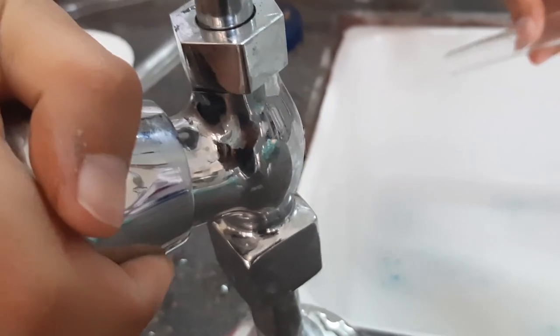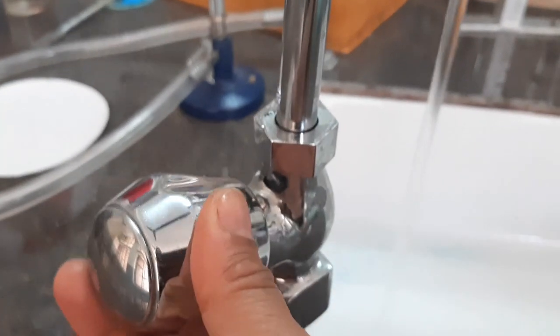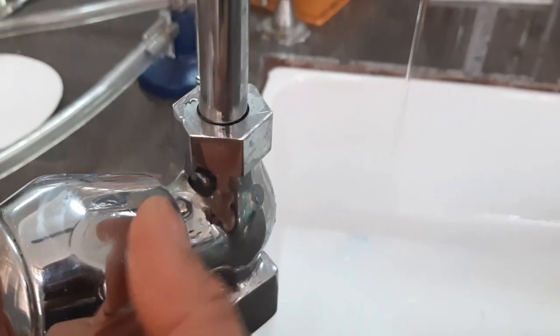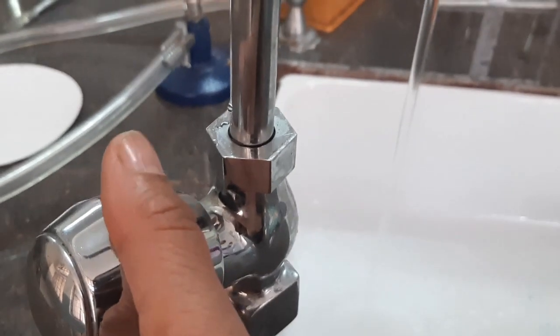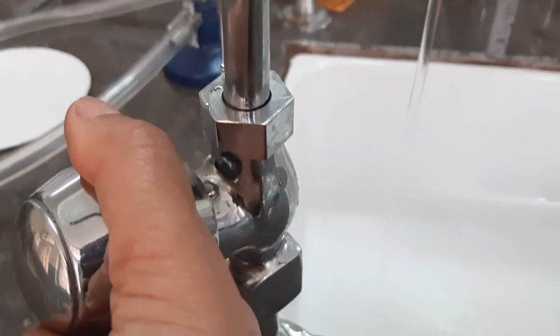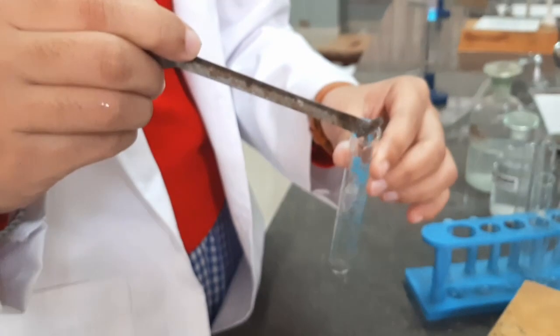Run water into the sink in order to avoid staining of your lab equipment. It's important to run water so that any extra material rinses off. This is just an extra step that you should always follow.